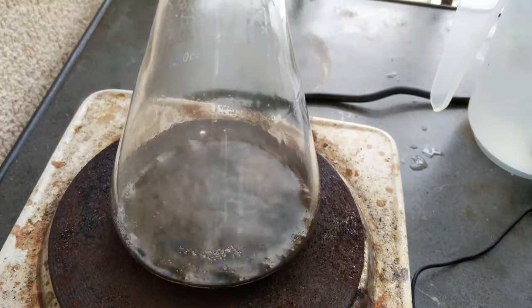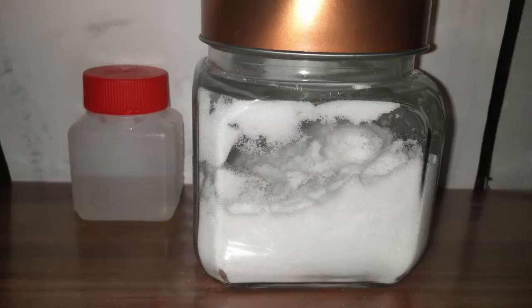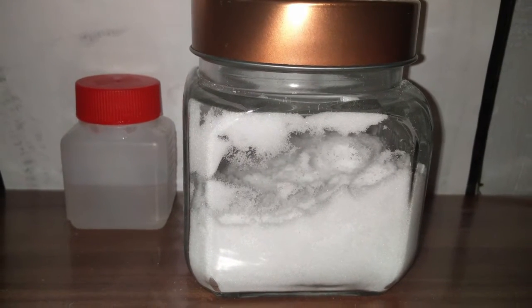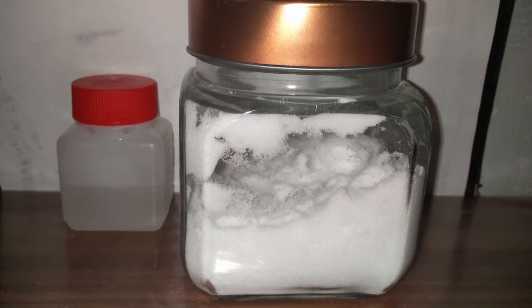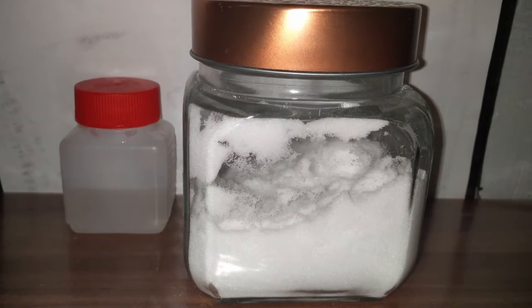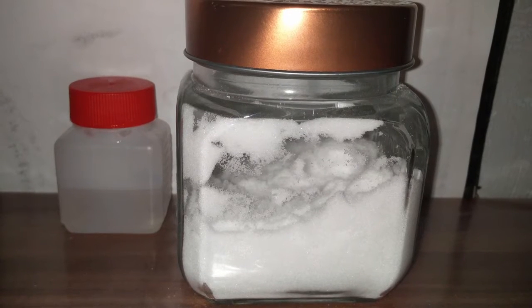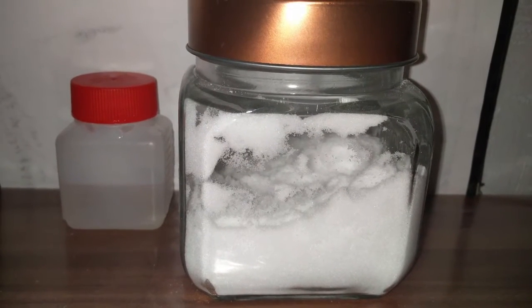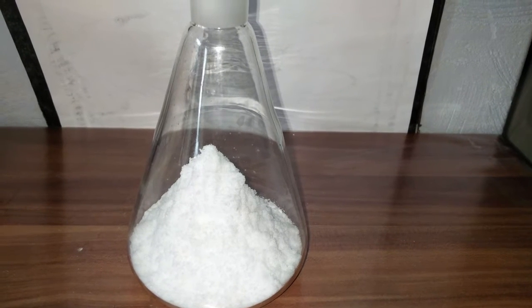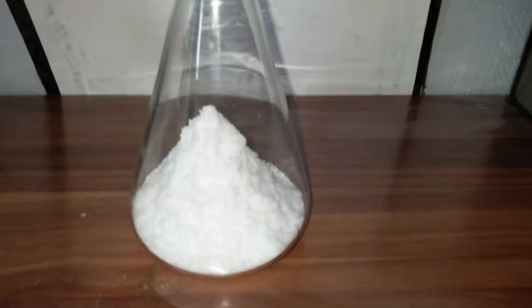Oxalic acid is much more available and it's also quite cheap. We are going to need about 100 grams of oxalic acid dihydrate, and some glycerin. Since it's just a catalyst, I use recycled glycerin which I got from my first try of making formic acid.